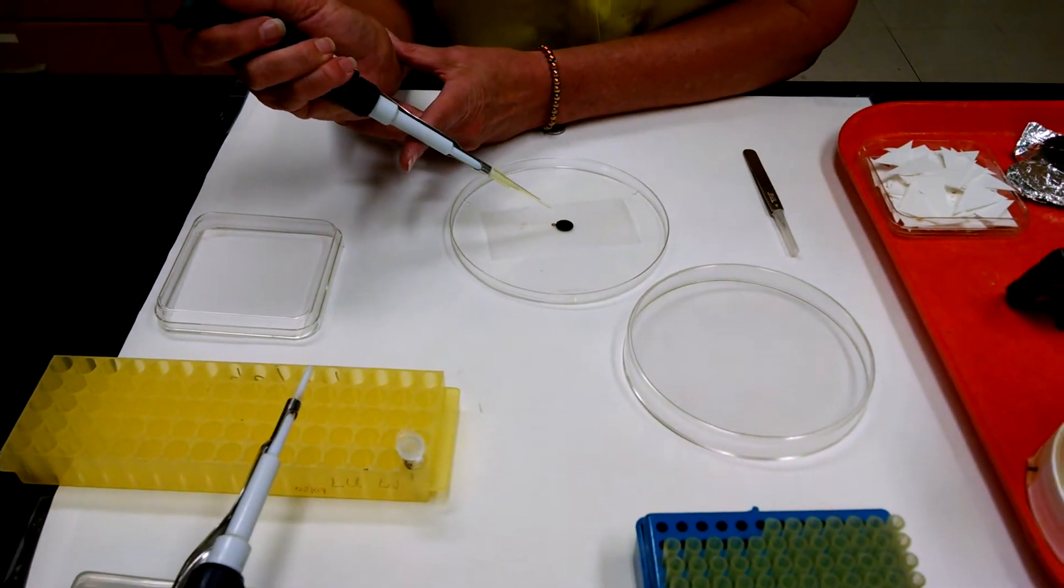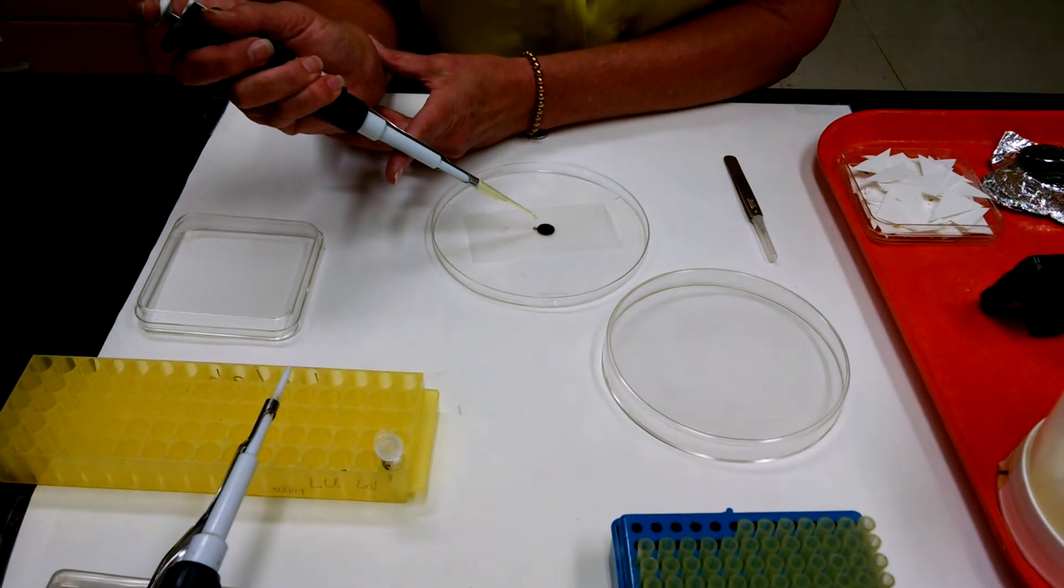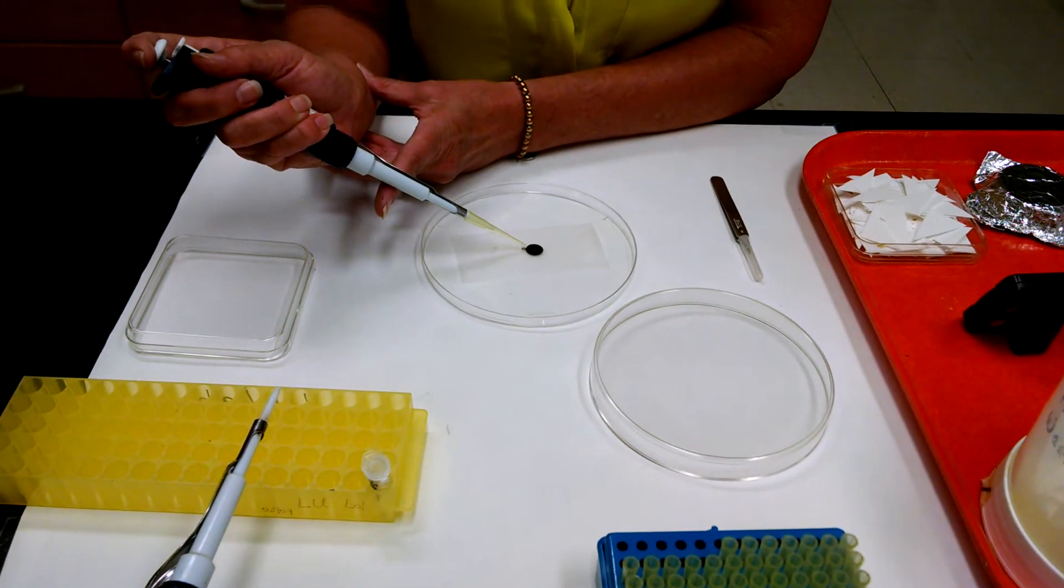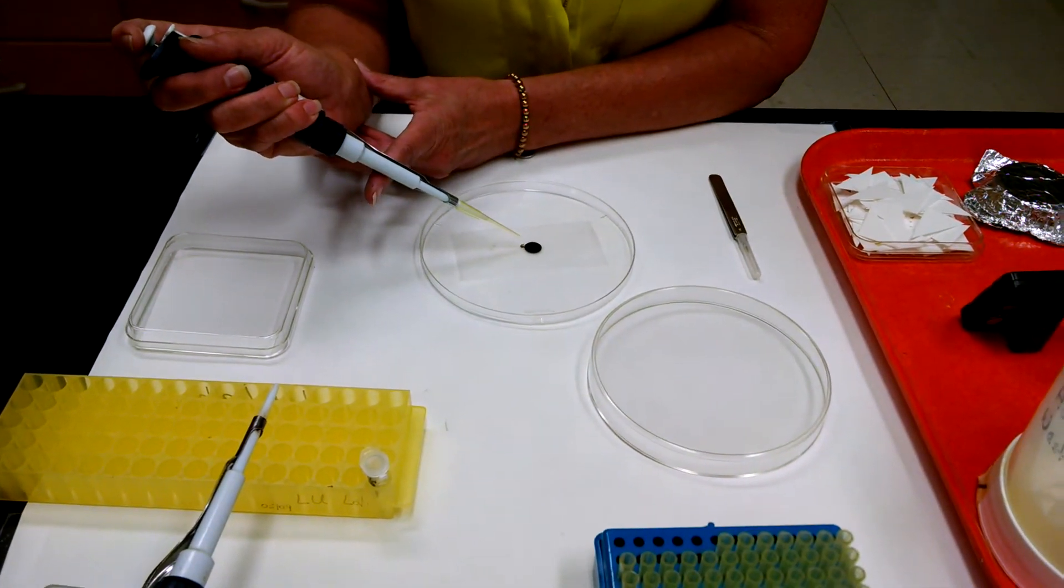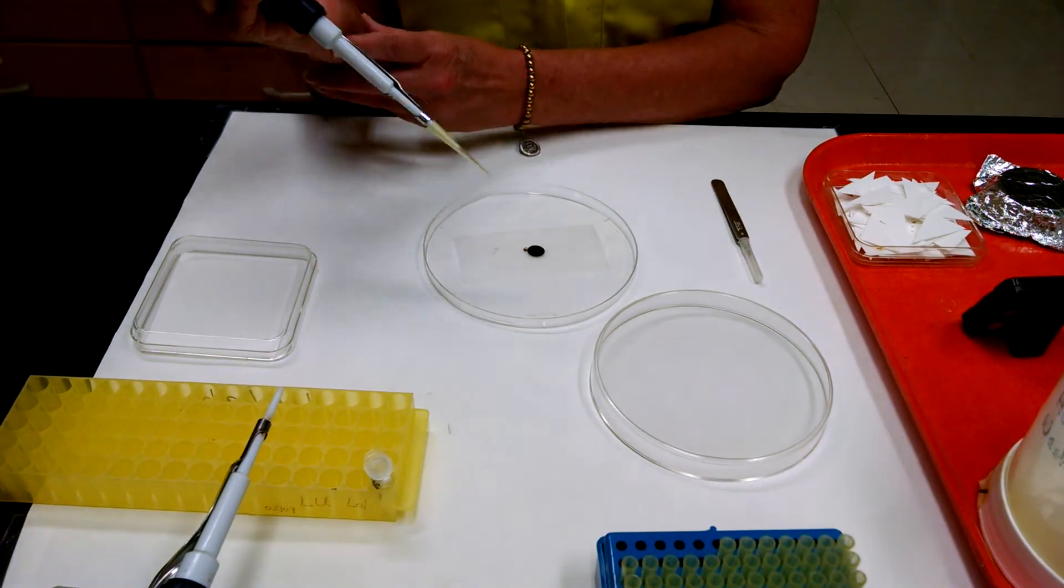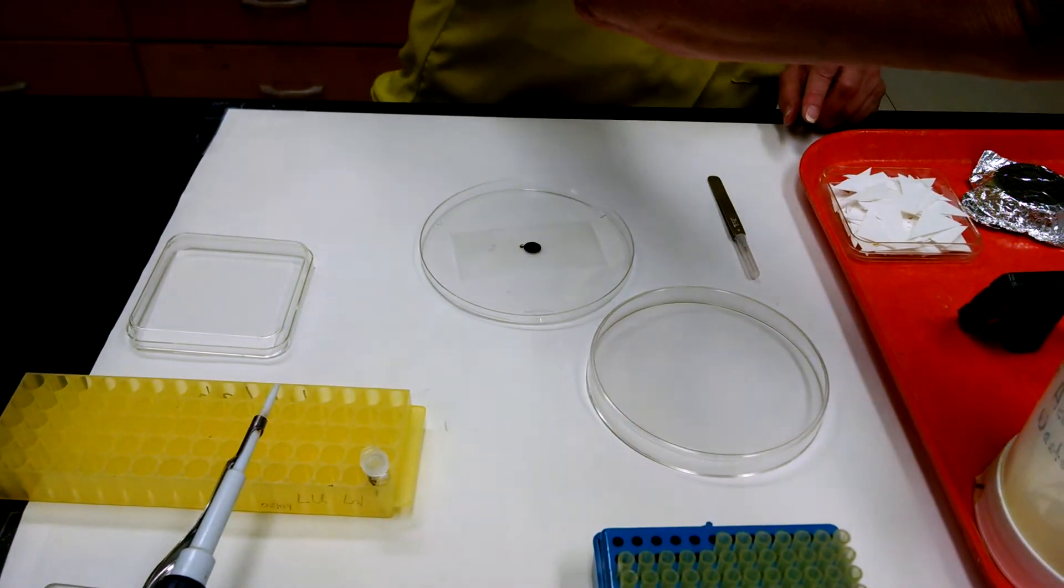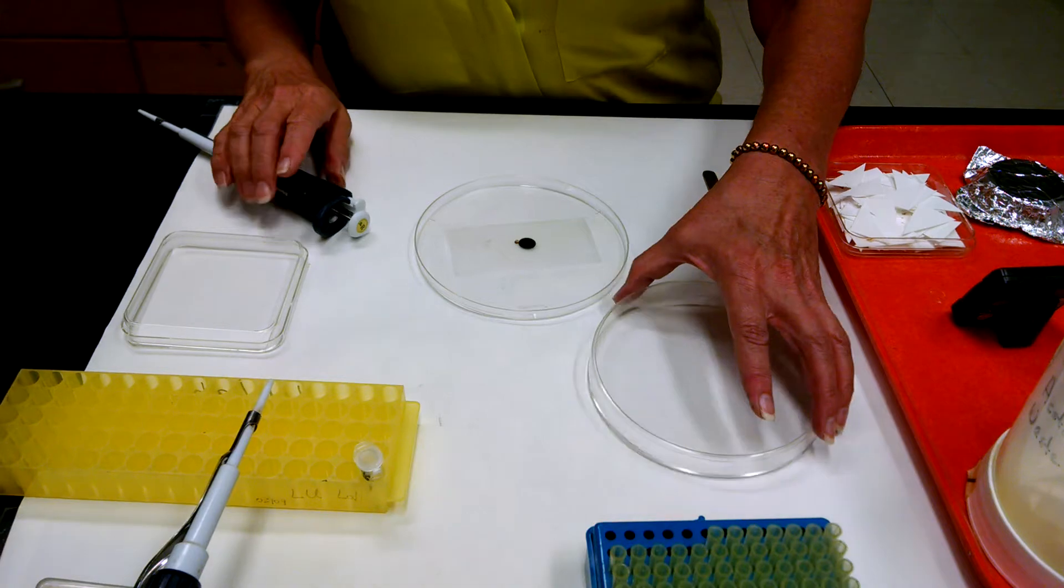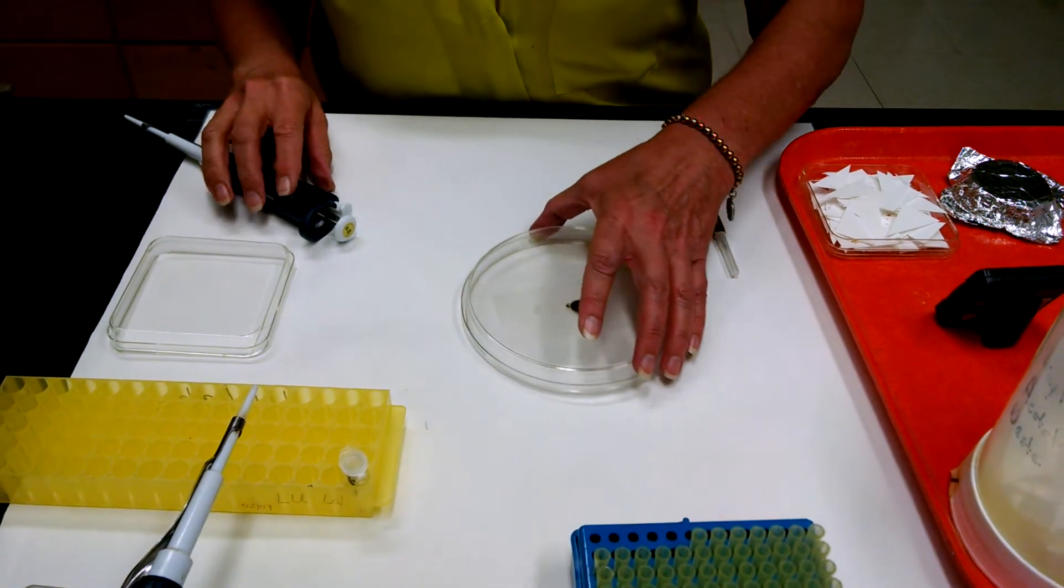And I found that if you make a droplet and then just touch it to the grid, it's an easy transfer. And there it is. Now I dispose of the tip and it's going to sit for three minutes.